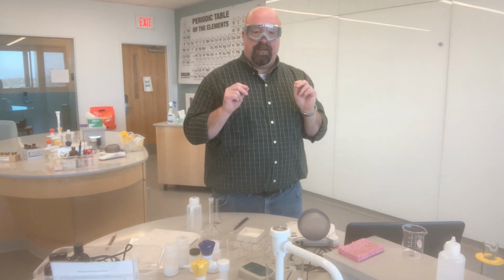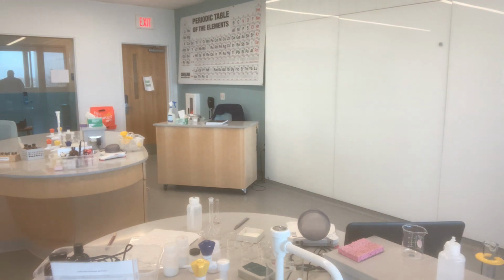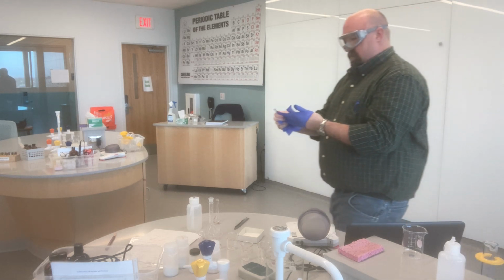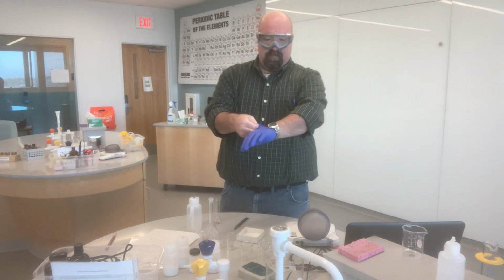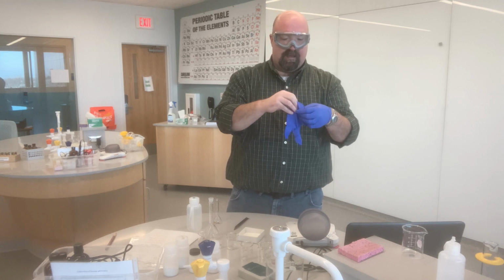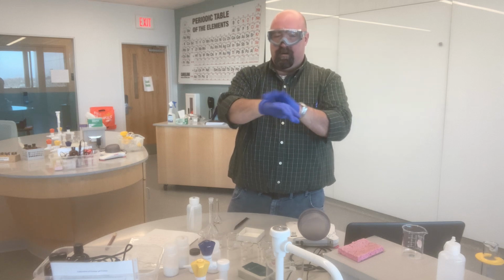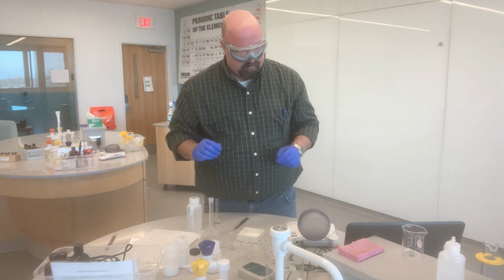I'm missing an important safety element here. Let me go get some gloves. Almost forgot, and I hope some of you caught that as you were watching the video. Now I'm safe and ready to go.